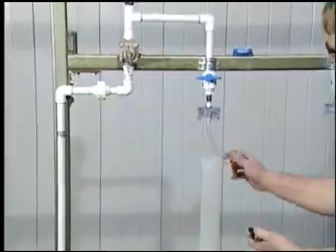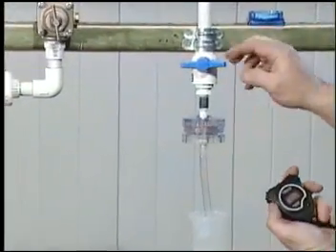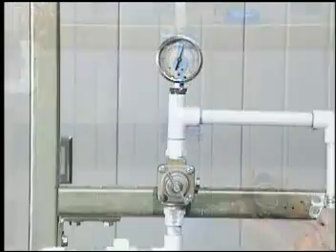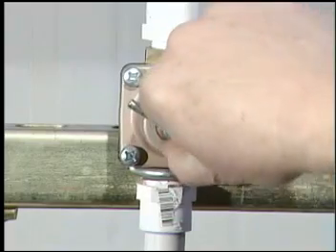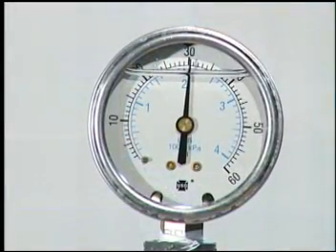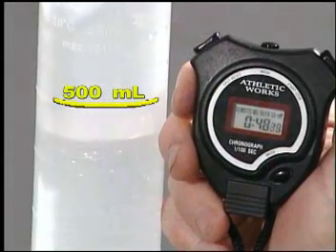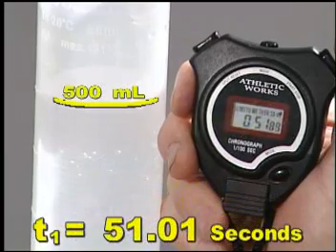A 500 milliliter graduated cylinder is placed under the filter holder. The operator starts a stopwatch at the same time that the inlet valve is fully opened. The pressure of the sample stream is maintained at 30 psi throughout the test. The operator records the time it takes for 500 milliliters to pass through the filter pad.